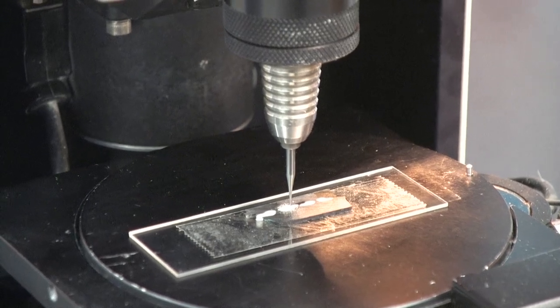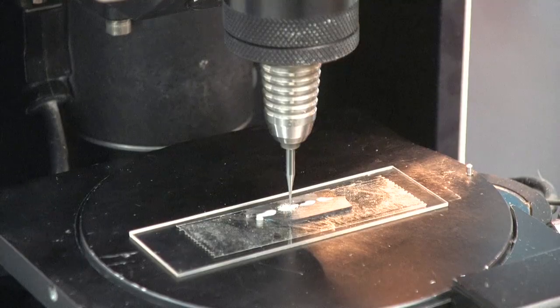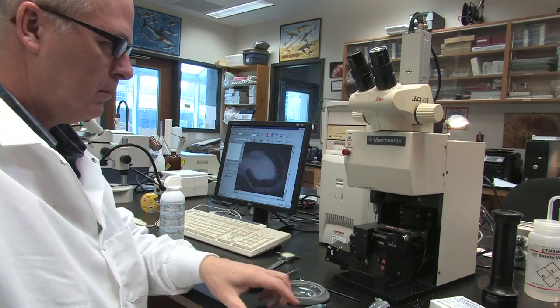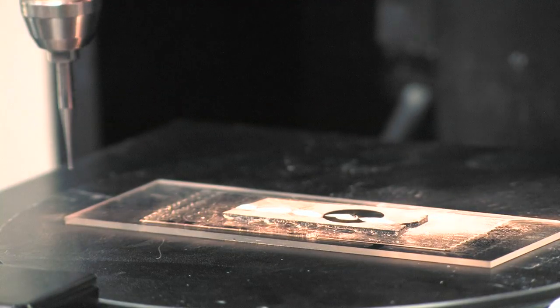When the drill is finished drilling this unwanted material, make sure you remove all excess powder from the sample and in the groove using compressed air, ethanol, small probes, and forceps. This is so that you won't contaminate the material you wish to extract.